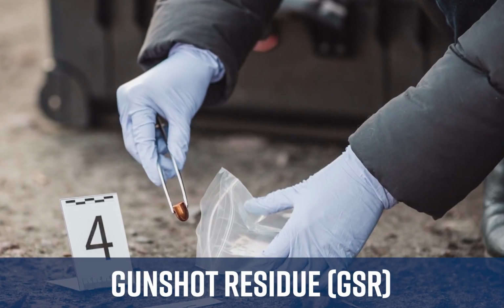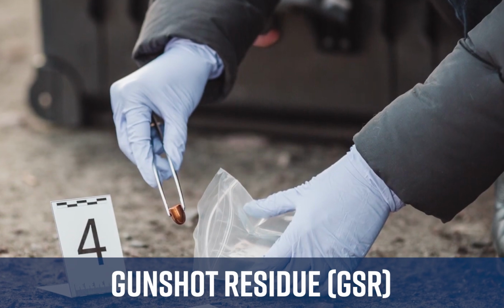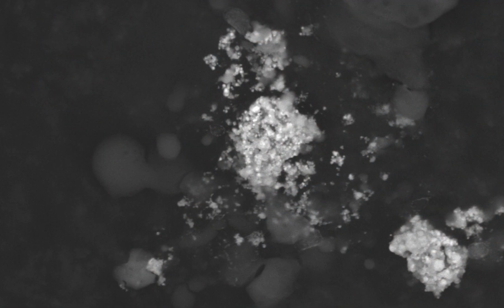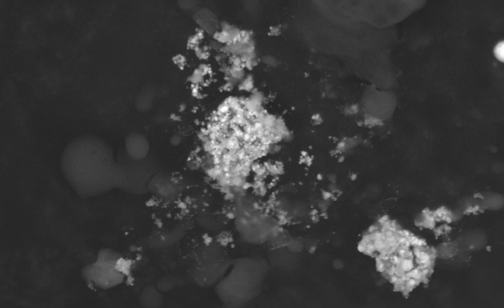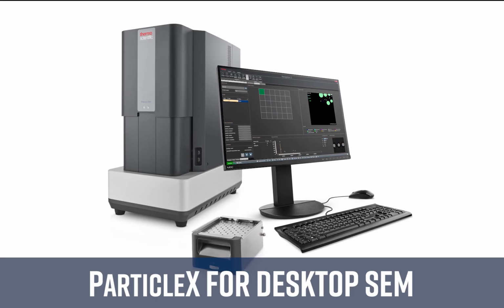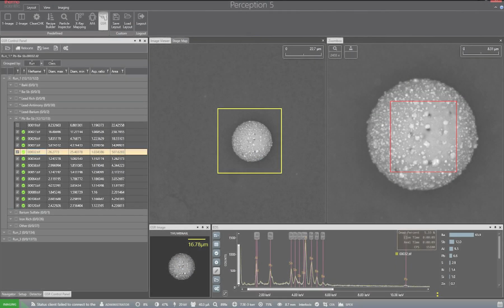Gunshot residue, or GSR, is a specialized branch of forensic science that focuses on trace evidence left by suspect shooters. GSR samples are often analyzed using scanning electron microscopy, or SEM, but this can be a menial and arduous task if done manually. The ParticleX software package on the Phenom XL desktop SEM automatically analyzes particles found on a sample.